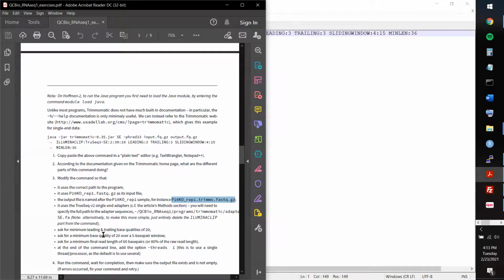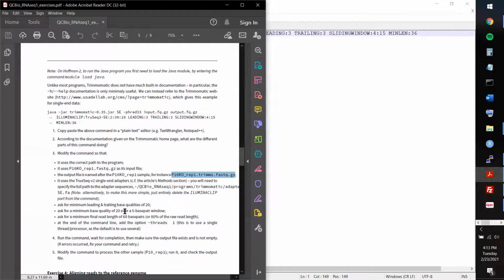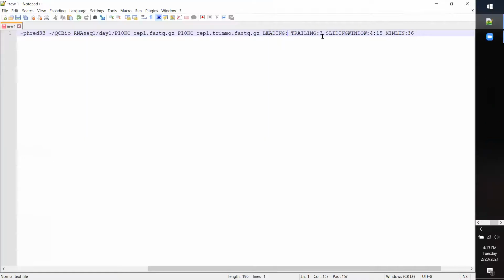And then I changed 20 over a 5 base pair window. I just sort of assumed that the larger number should remain the larger number. So I changed that to 20 over here and this to 5. So I guess I can just do that like 20, 20, 5, 20, and then you wrote to make the minimum length some more than half fraction, whatever. So since we're dealing with sequences that are like in the 70s, you recommended 60. And I think that completes the command.